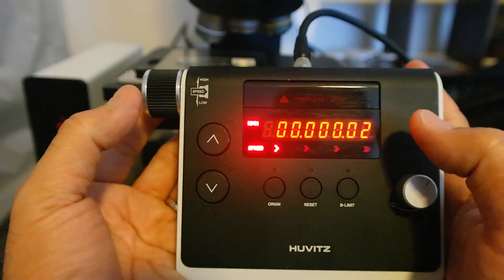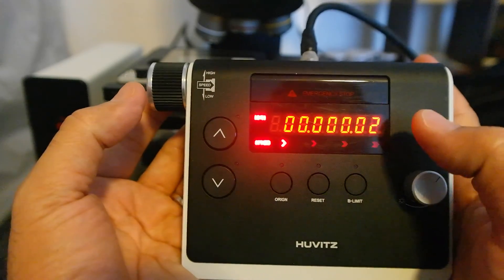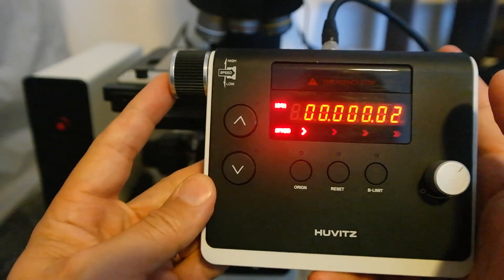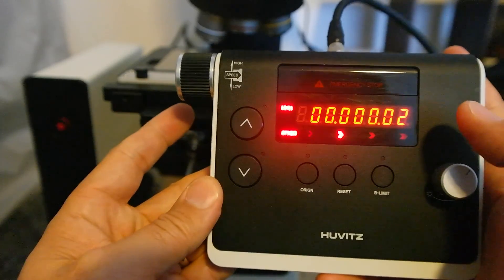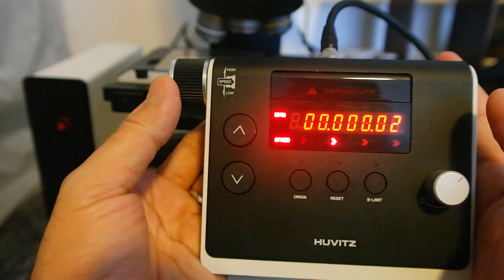0.02 micron or 20 nanometer up. And if I speed up to the second one, basically this goes 10 times faster as you see.